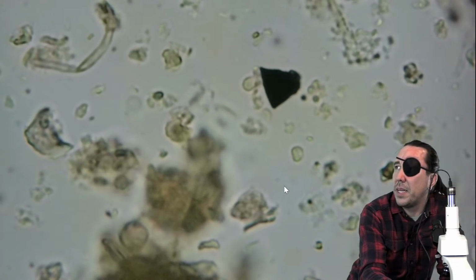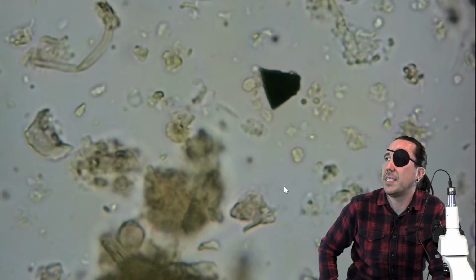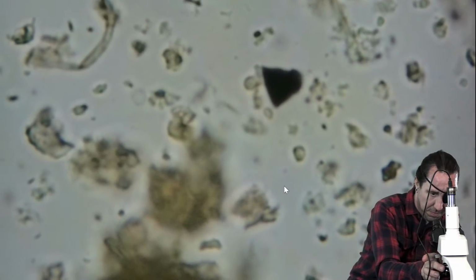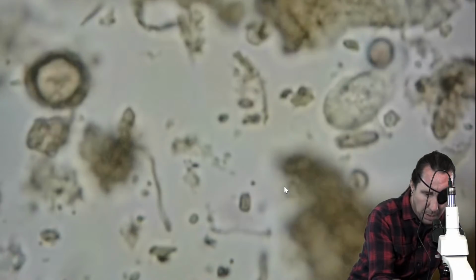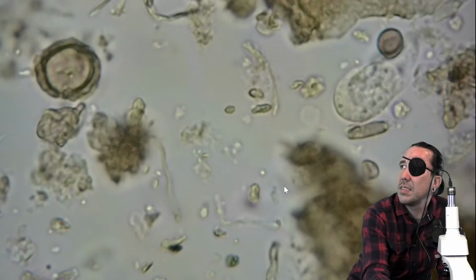Because of the way that's butted up against her, I can't positively identify something. If you can't positively identify something, you can't guess that it is that and note it. It's not a good practice to do that, I should say. So then, yeah, I'm looking at that, looking at a view. I flip to another one. I just happen to move this.